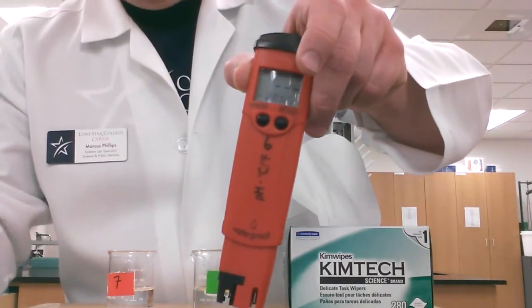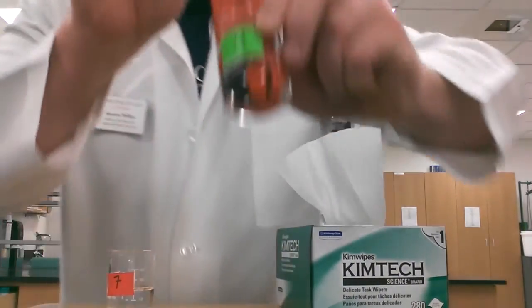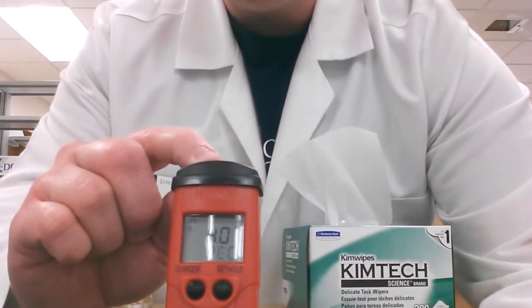It's waiting for the pH 4 solution now, so we're going to go ahead and put it in the pH 4. So once we put it in the pH 4, it will detect that it's in the pH 4 solution and it's going to start calibrating.